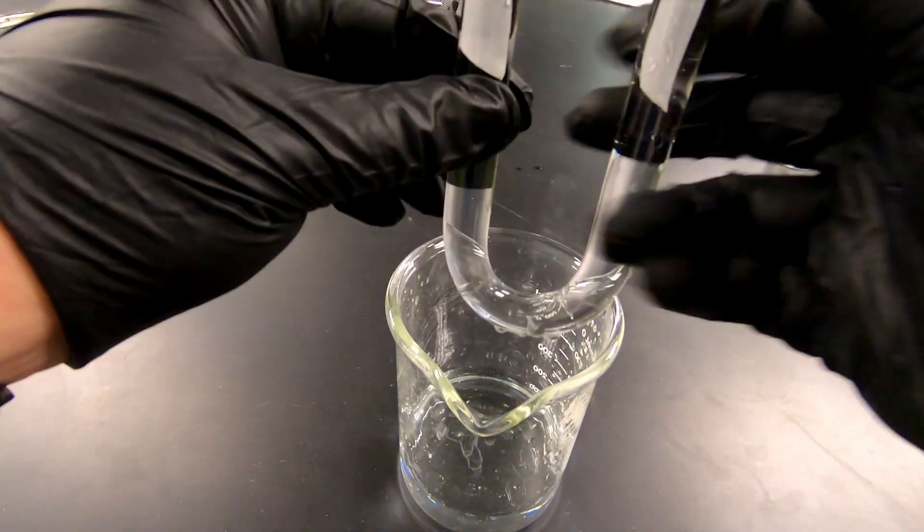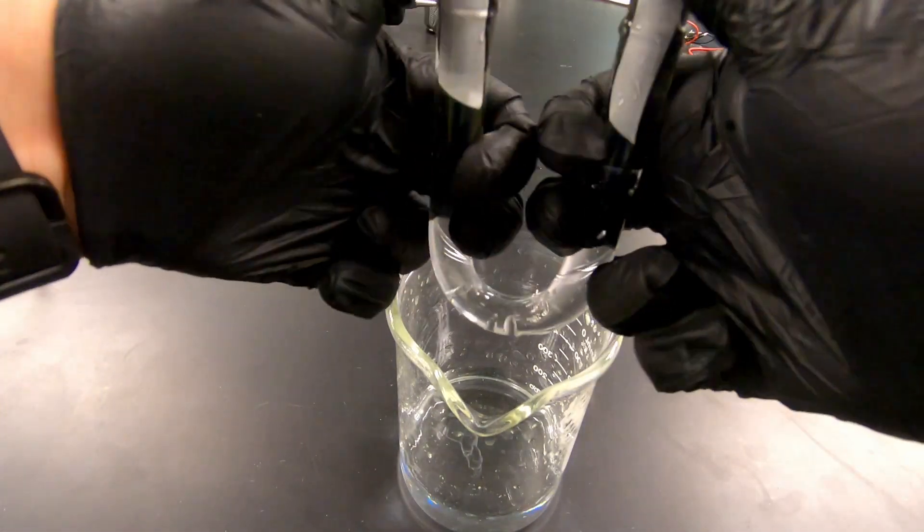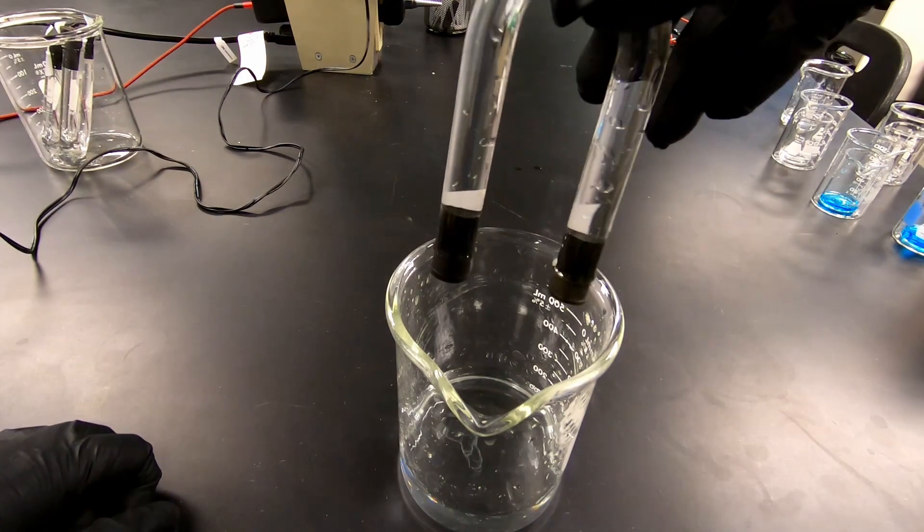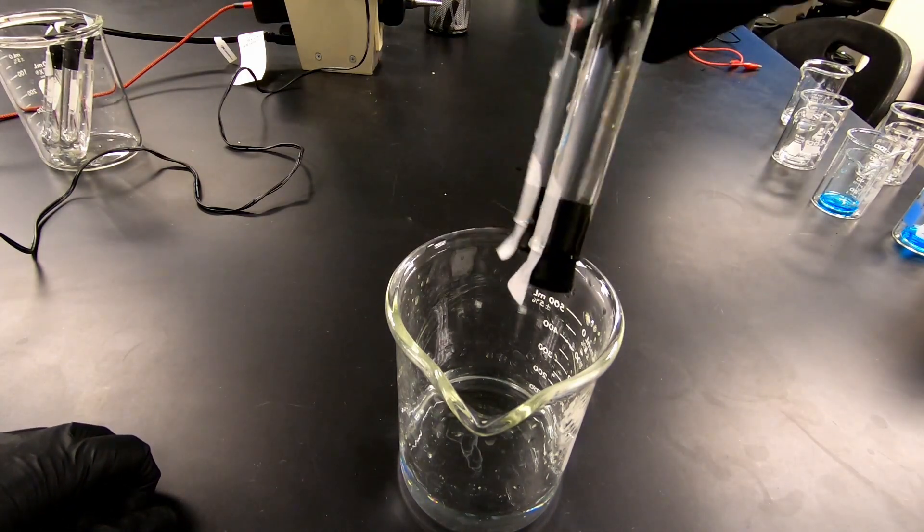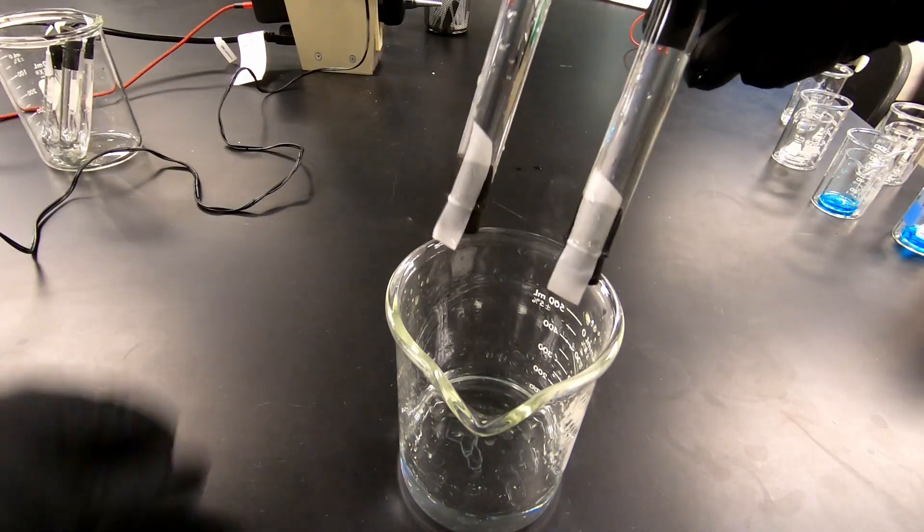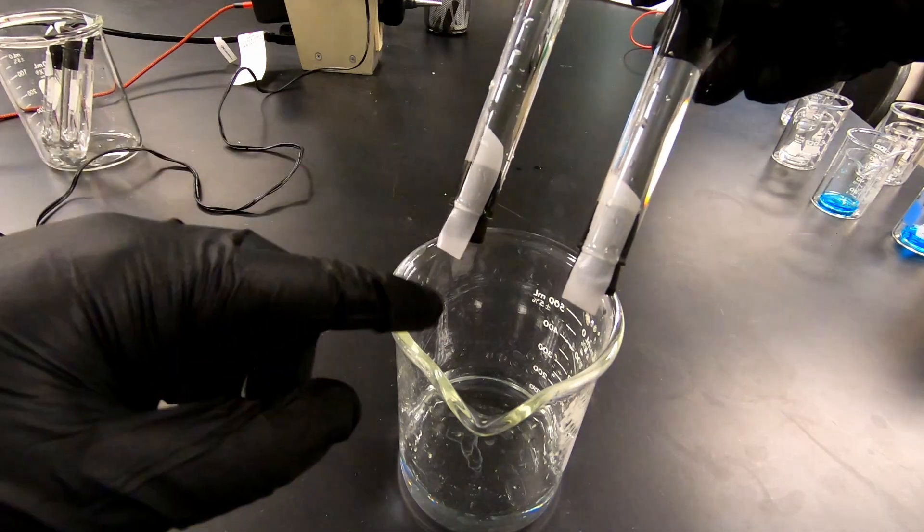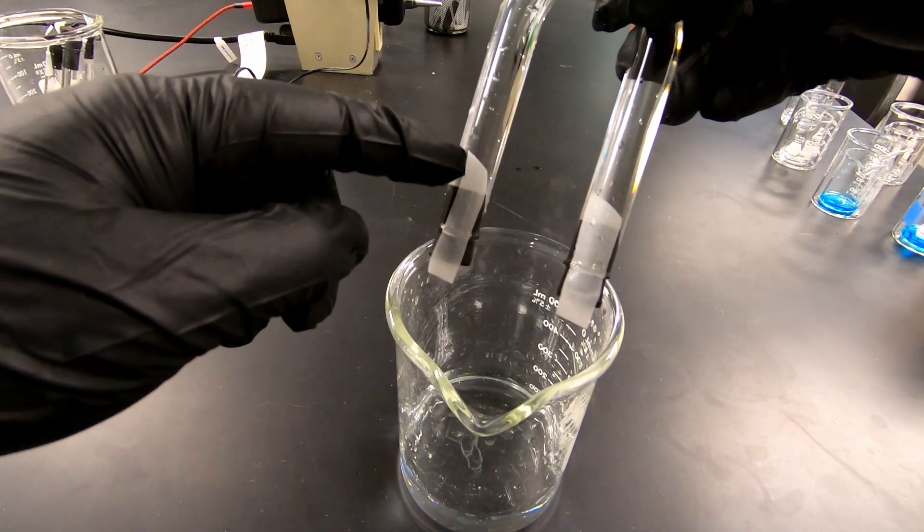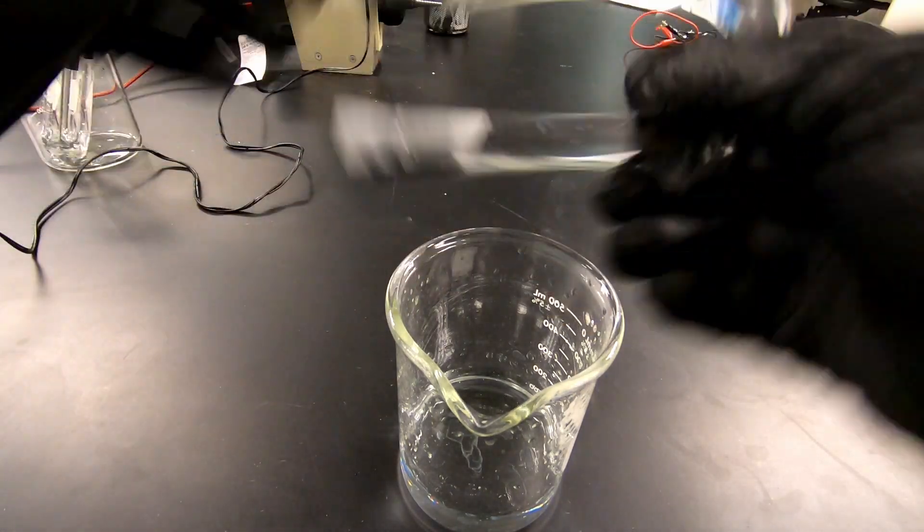And then you'll want to just invert it real fast. Make sure you got no leaks. That looks good. Triple check that your filter paper is touching the salt and hangs out the end. We look great.